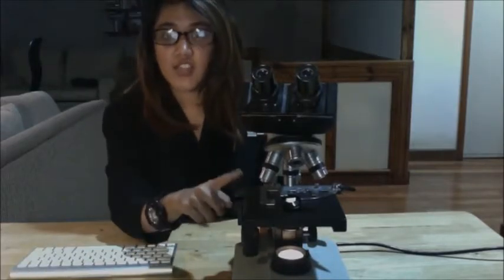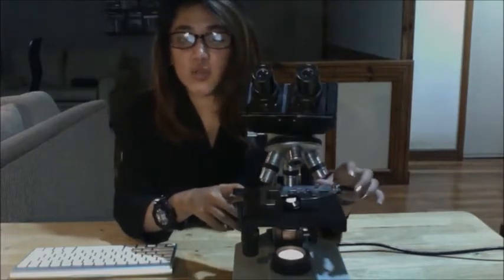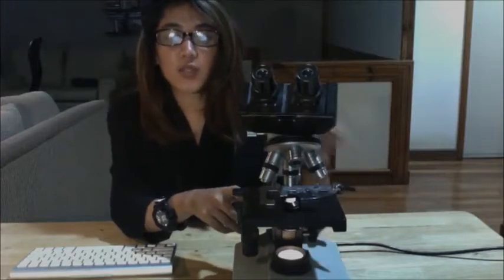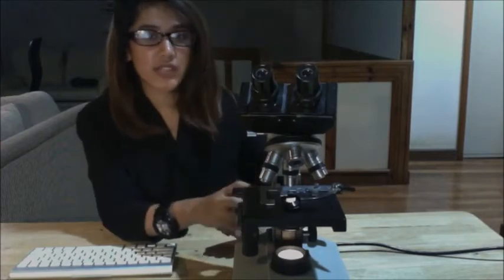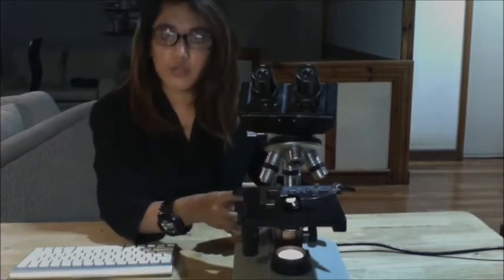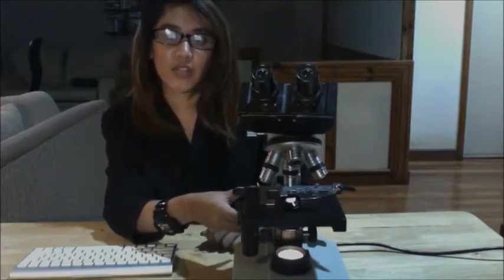Let's go back to the other parts of the microscope. You have the stage, the flat surface on which the slides are placed, and on your stage you have the stage clip, which holds your slides in place. Then you have the condenser lens, which focuses the light onto the specimen. And then the diaphragm, or iris, has different size holes and is used to vary the intensity and the size of the cone of light that is projected upward onto the slide.